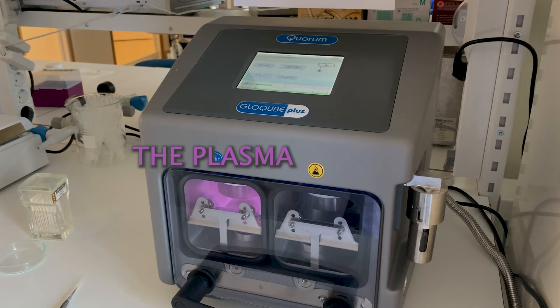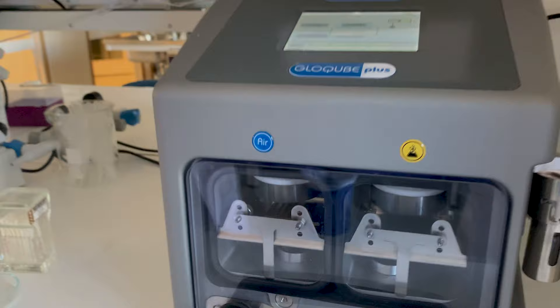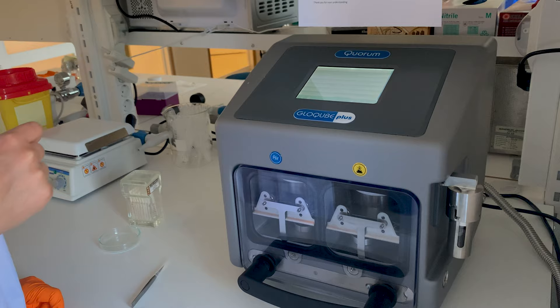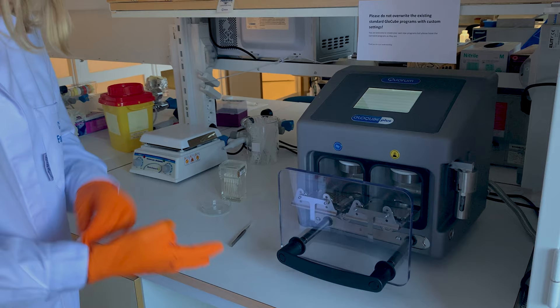If you look down you can see the plasma itself. We can also see a bunch of sparks flying around — this is normal, nothing to worry about. It says 'process completed' and we just click confirm. It should have automatically vented, so now I can open the chamber and take out my little support platform with the grid.